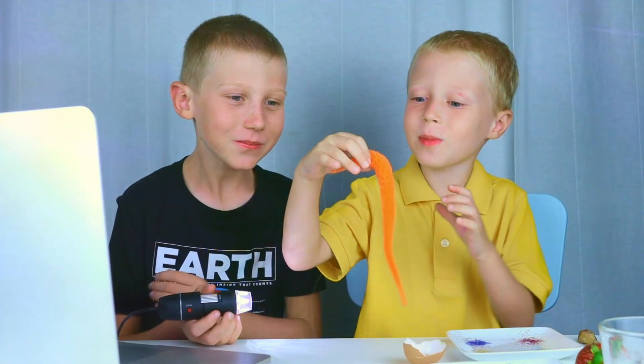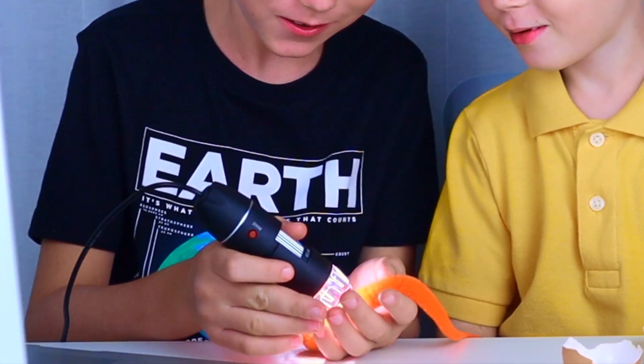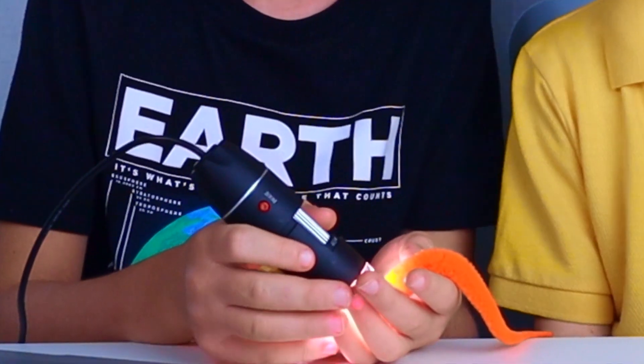Oh man, look at this. Cool. Wow! Look, it looks like orange spaghetti. Orange spaghetti or orange hair.